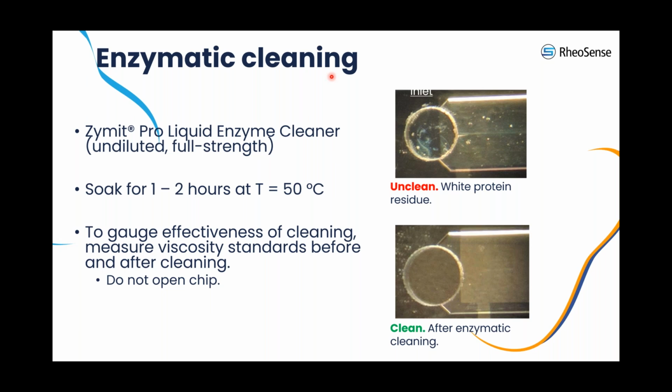As shown in the image here in this slide, you can clearly see the chip before and after Zymit cleaning. The difference is evident with the Zymit solution successfully removing protein residue from the chip. This process significantly enhances the quality and accuracy of the data you can obtain. Okay, now I'm gonna turn it over to my colleague, Dr. Ochoa, and he's gonna go over some details about chip maintenance and start sharing some good and bad data with you.